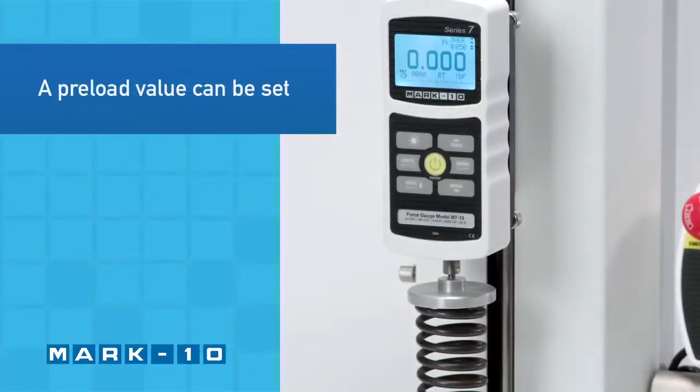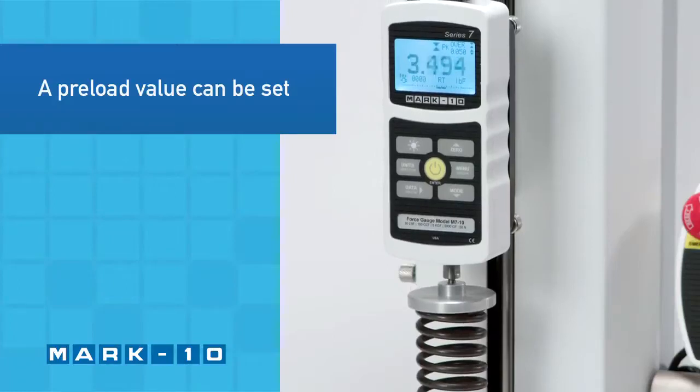A preload value can be set to automatically zero the travel display at initial sample contact.